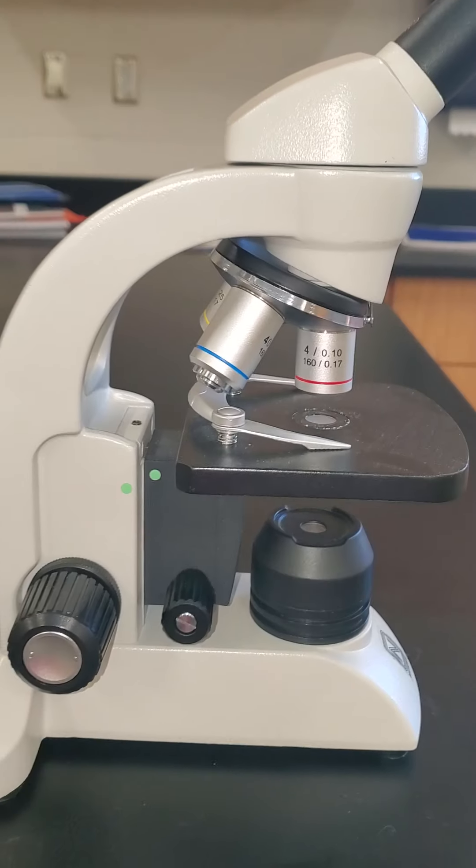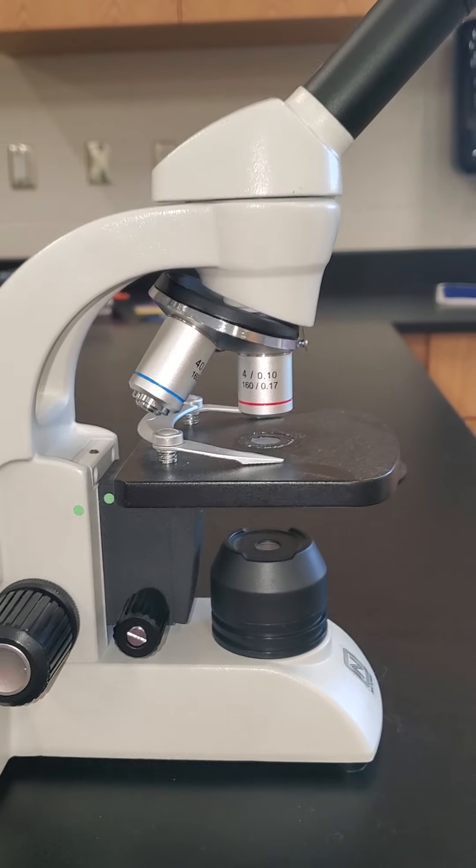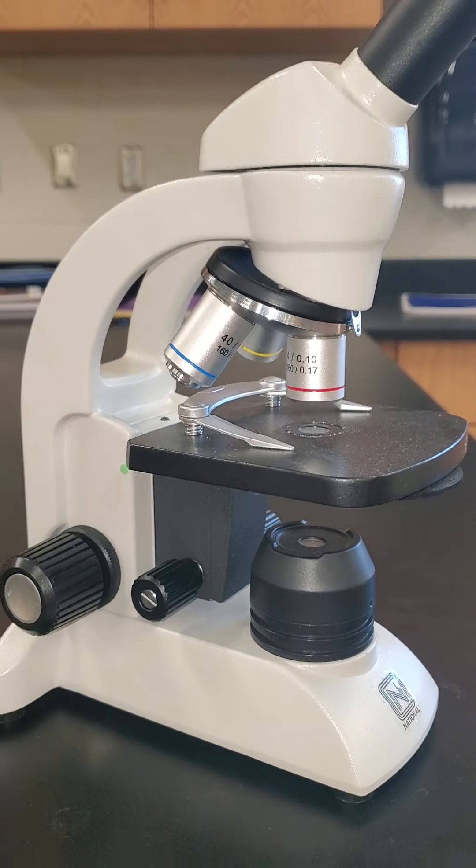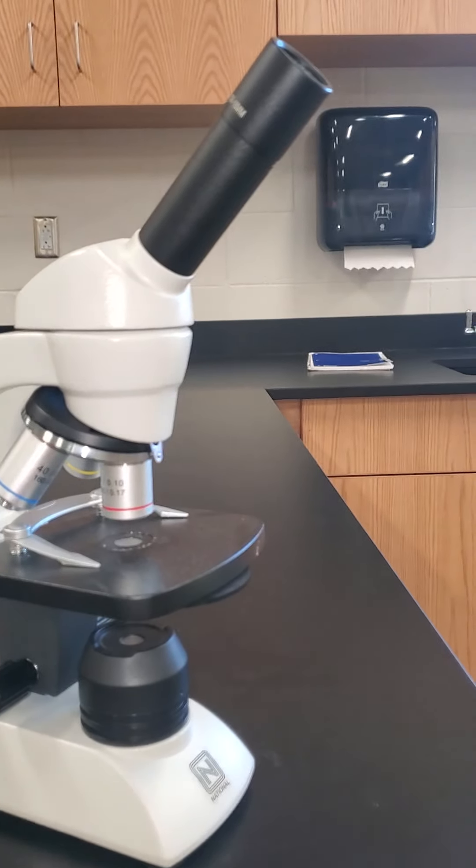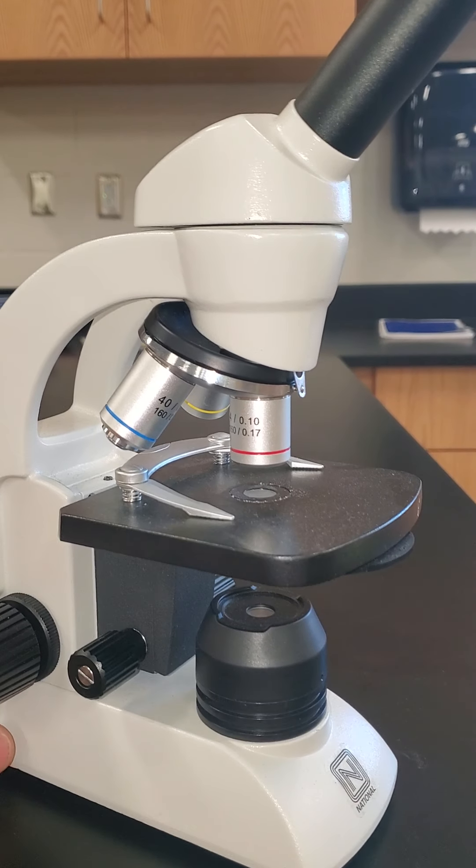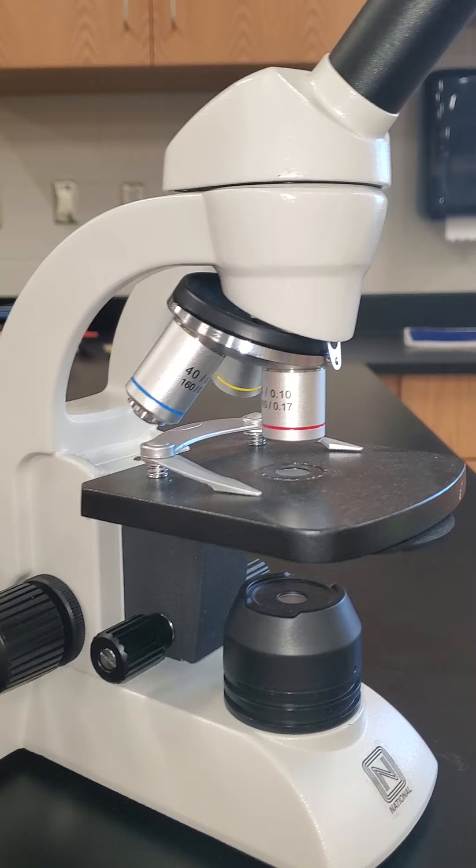Hello guys and girls. Today we're going to be taking a look at a compound microscope that you will have the ability to use in your science classes and your science labs. This is a three lens compound microscope.